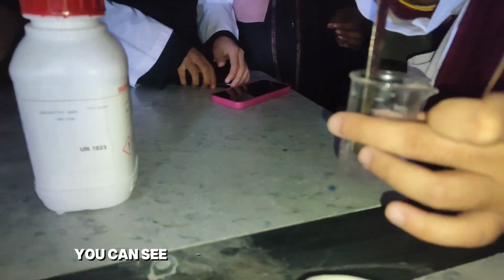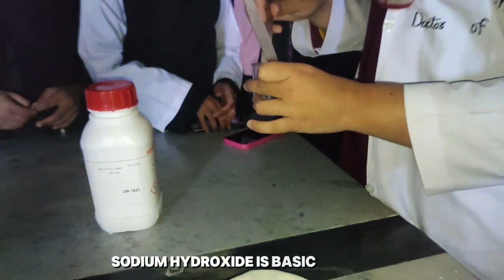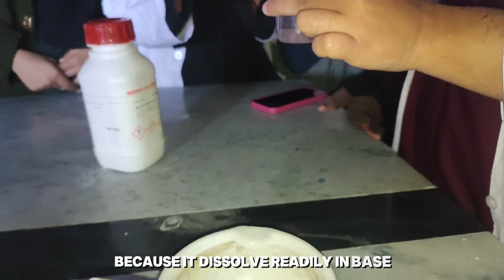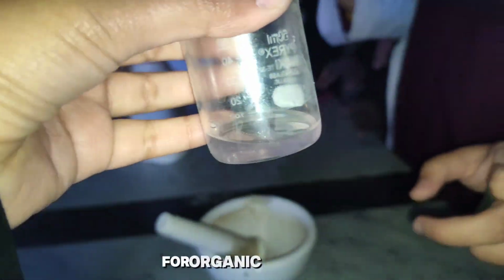Now you can see phenol dissolves easily in sodium hydroxide. Sodium hydroxide is basic in nature, while phenol has an acidic nature. So we confirm it has an acidic nature because it dissolves readily in base. This is how we perform the identification test for an organic compound.